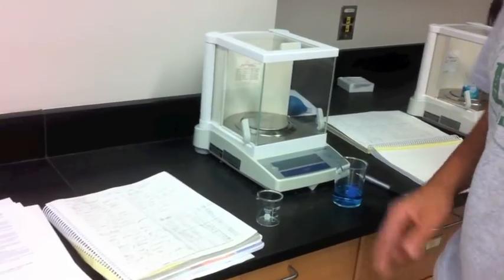Subtract it from the results. When you first measured this, it's the initial mass which you get right there.